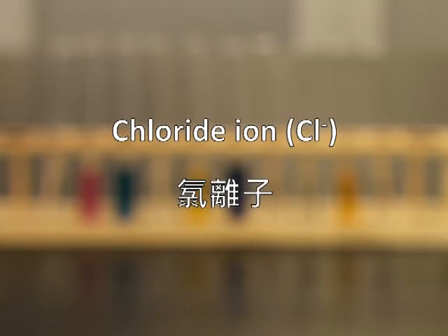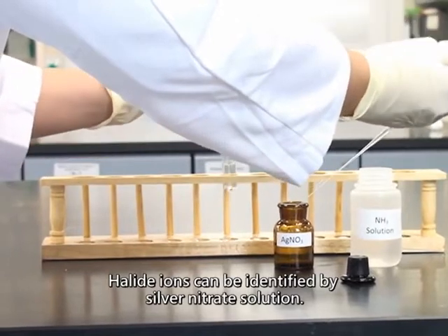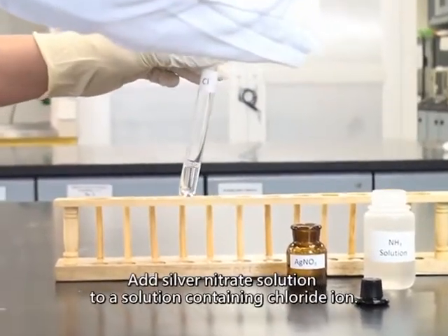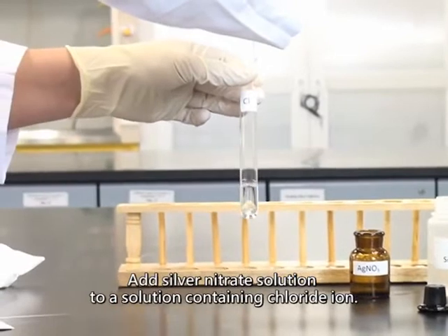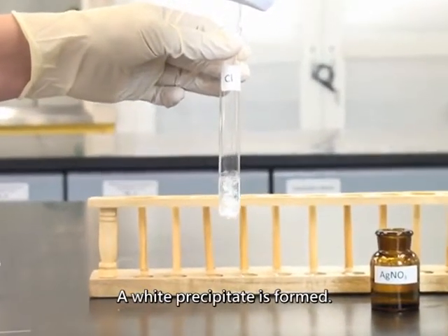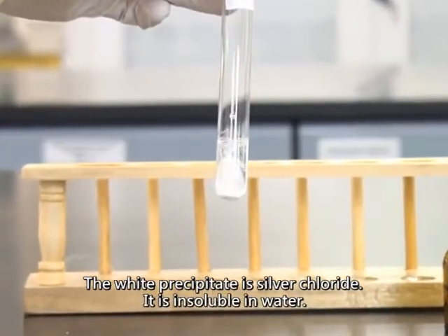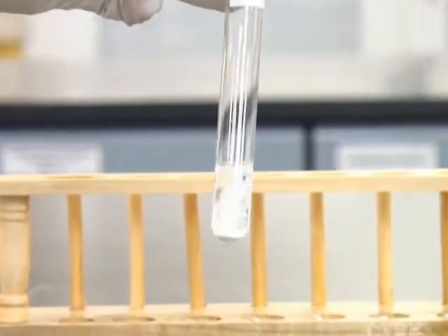Chloride ion. Halide ions can be identified by silver nitrate solution. Add silver nitrate solution to a solution containing chloride ion. A white precipitate is formed. The white precipitate is silver chloride. It is insoluble in water.